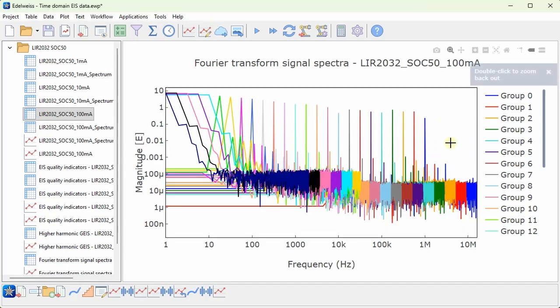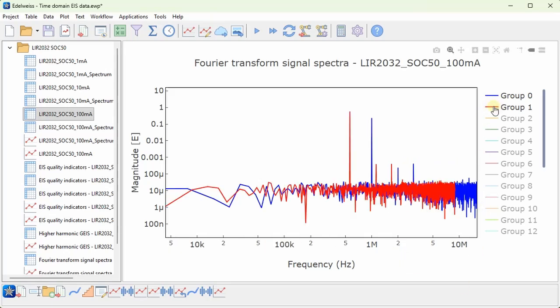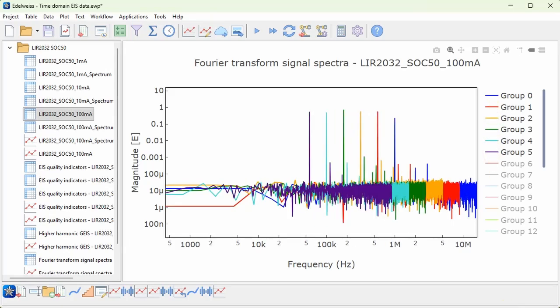These are then the raw Fourier transforms. If we look at the first one, this is for 1 megahertz, and we can see the peak at 1 megahertz indeed. And otherwise it's mostly noise as expected, but we do also have some peaks at the multiples of 1 megahertz, so 2 megahertz, 3 megahertz. And that is of course what enables calculating the higher order spectrum. And then we can see the peaks shifting to lower frequencies as we measure the lower frequencies.